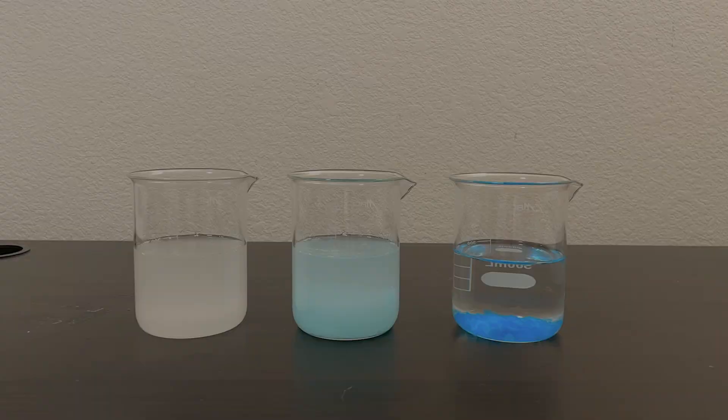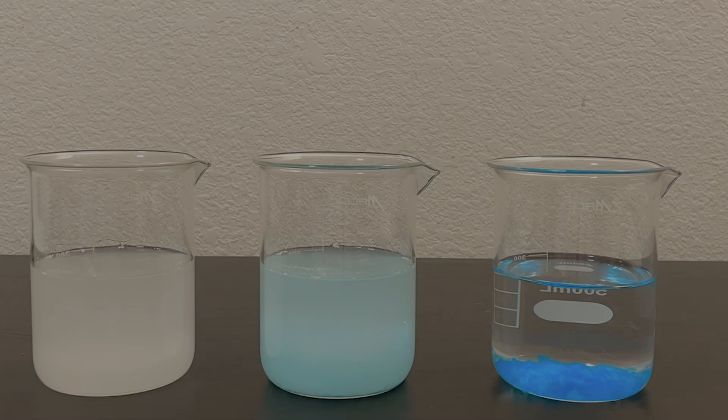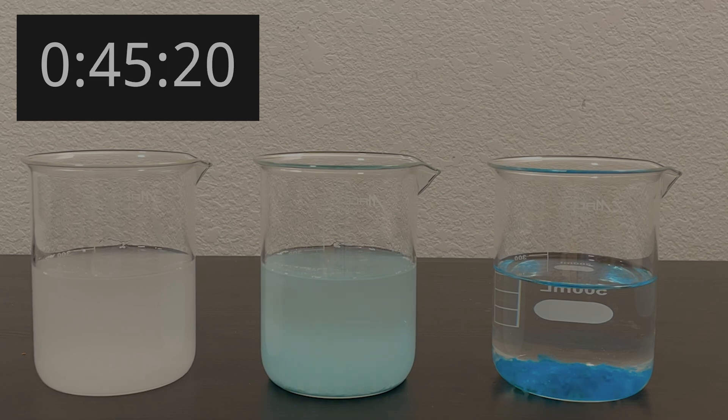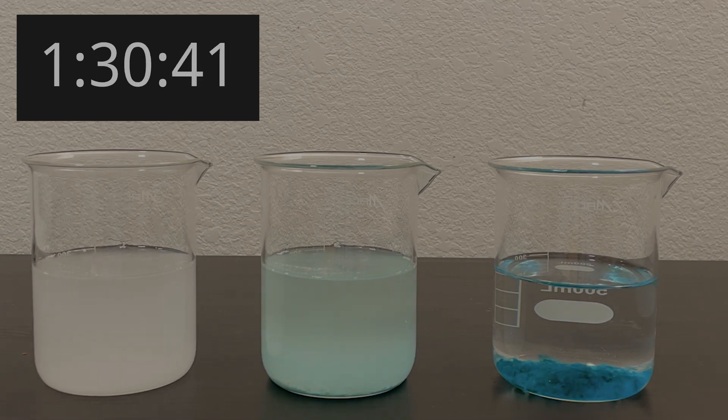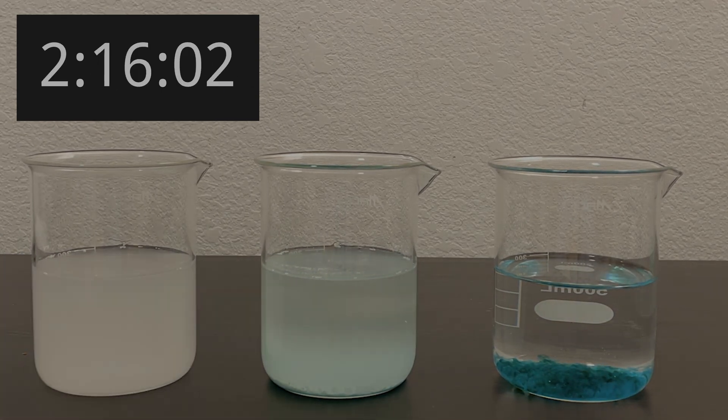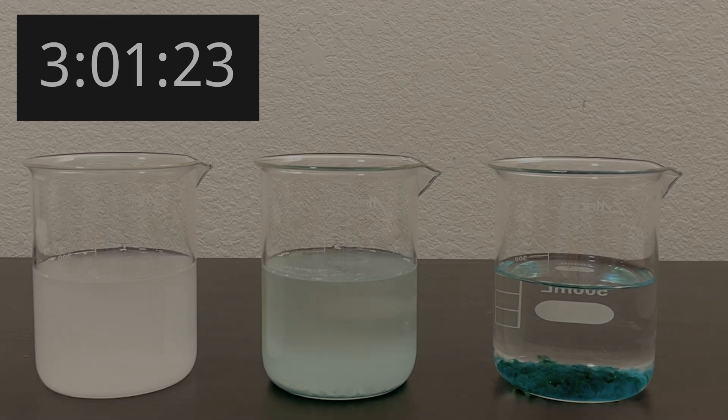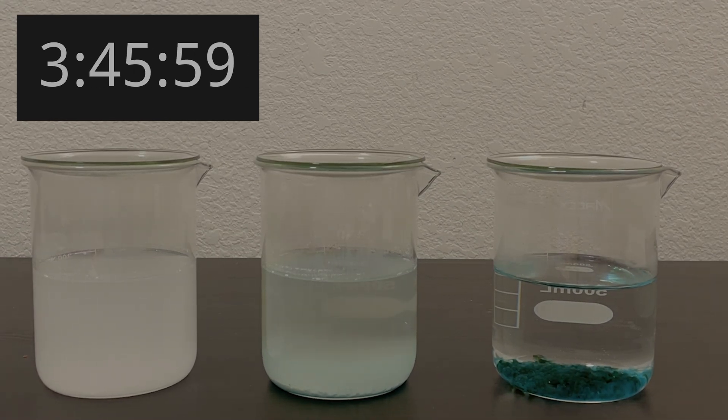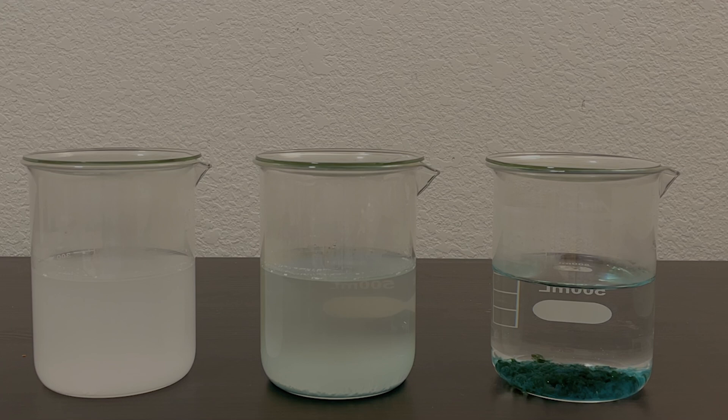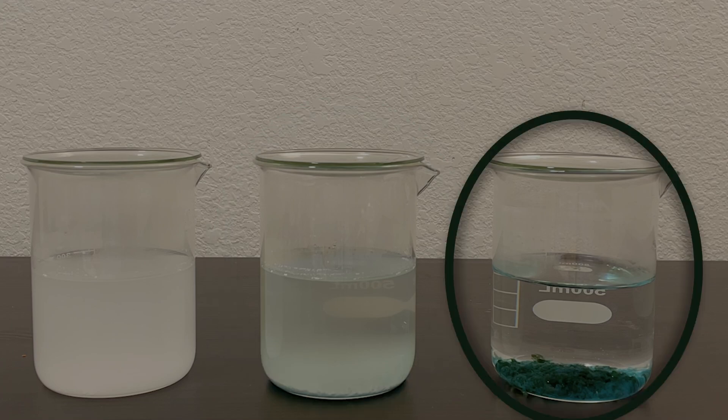Well, I haven't even shown you the coolest part. If I leave these solutions out for a few hours, this happens. The left solid stays white, the middle one turns light gray, and the right one turns black.